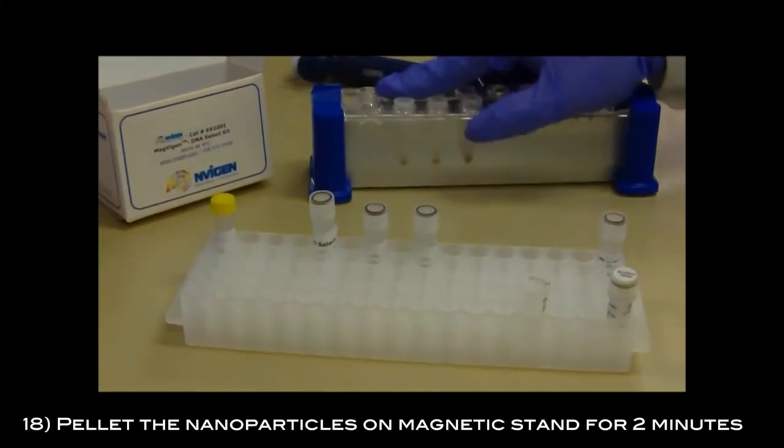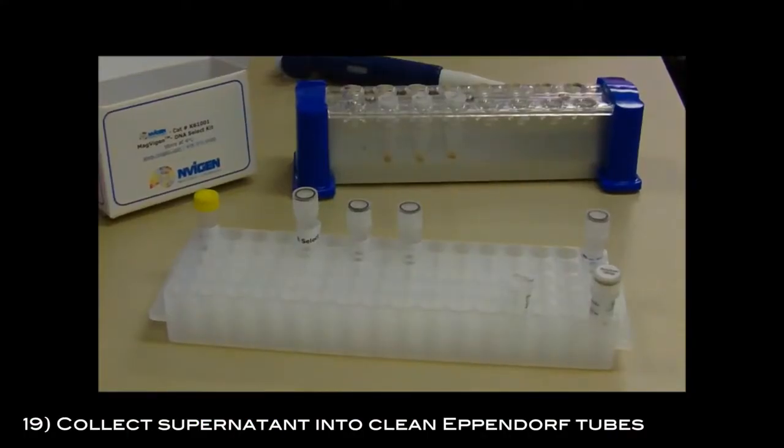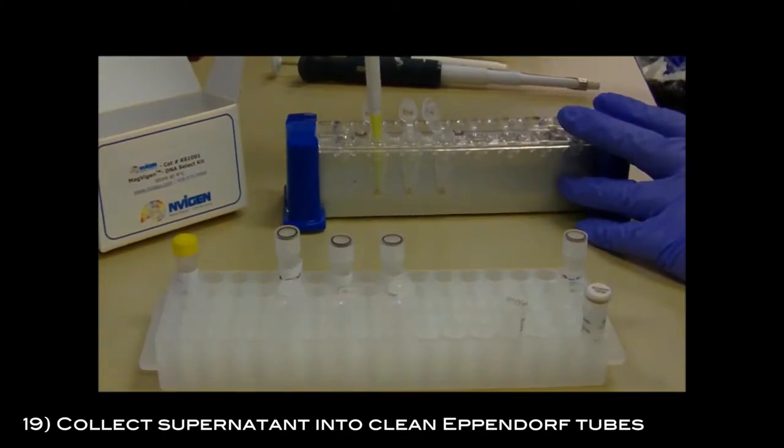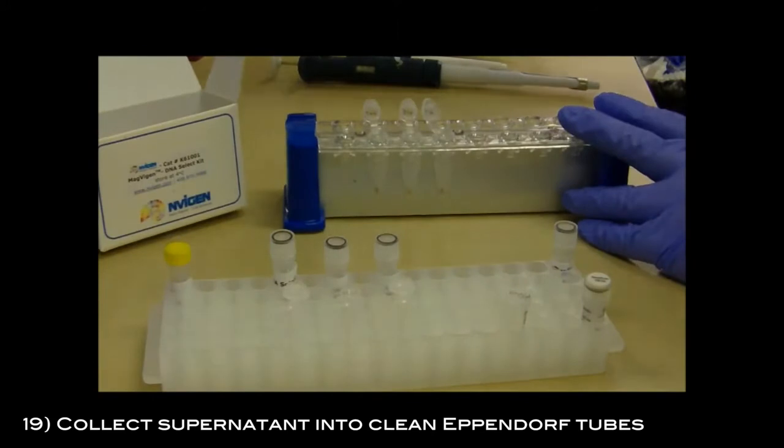Pellet the nanoparticles on magnetic stand for 2 minutes. Then collect the supernatants into clean eppendorf tubes. This is the size selected DNA product.